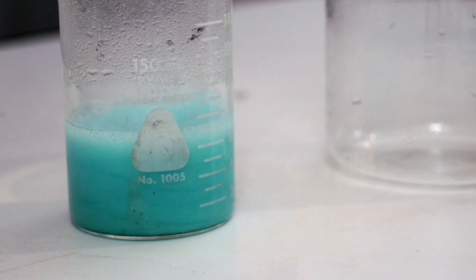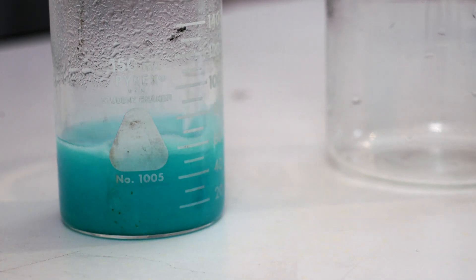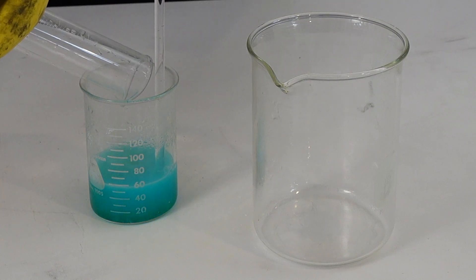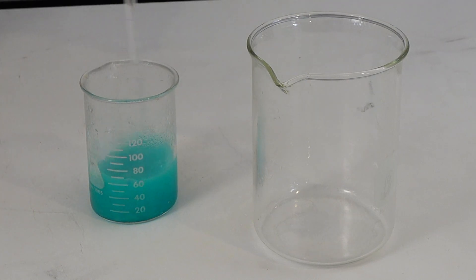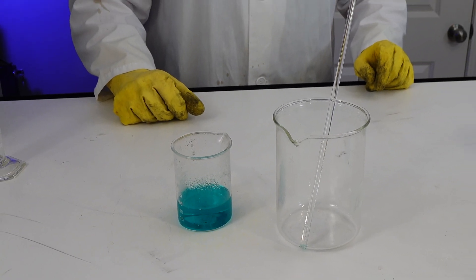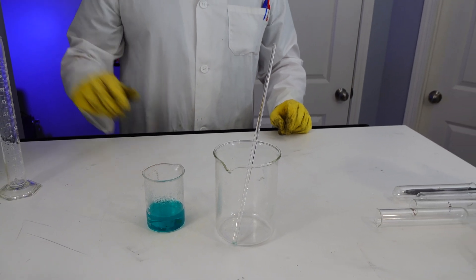So you saw that burst of green. We will try to permanently make it green later. There's some chunks and they're fizzing away, but that won't be a problem for our purposes. So we will get to making some pretty colors.